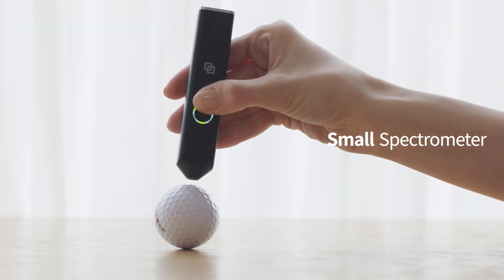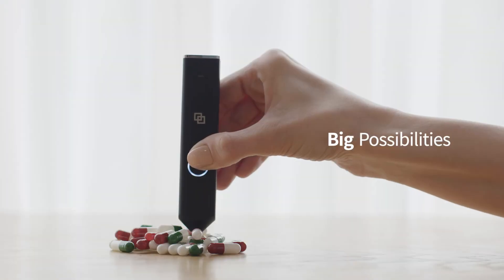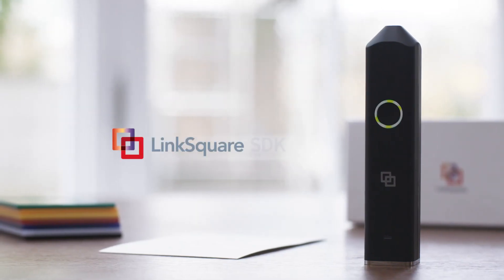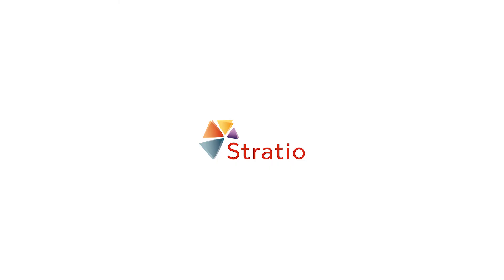Small spectrometer, big possibilities. LinkSquare SDK. Stratio.